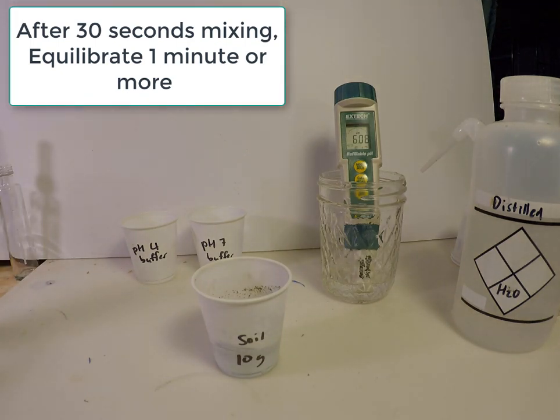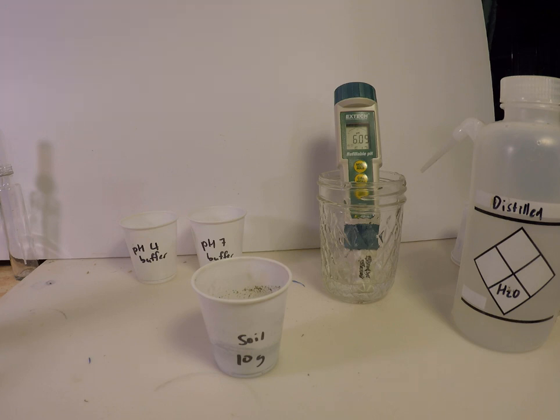Then, the soil water mixture can be left to equilibrate for at least 1 minute. During this time, additional soil samples can be prepared for measurement.